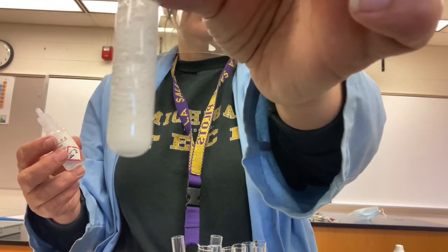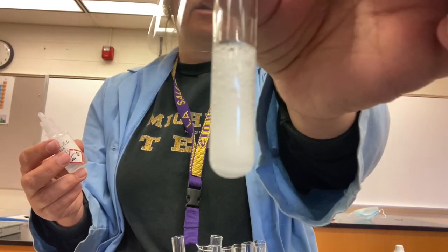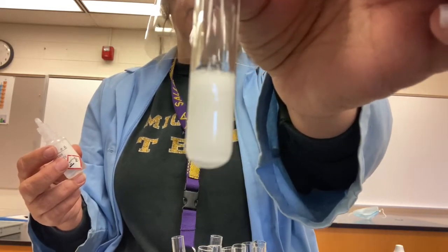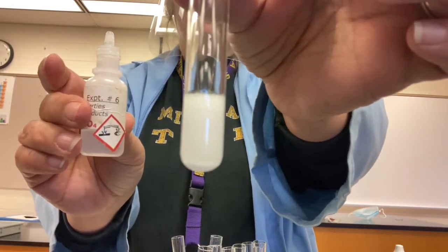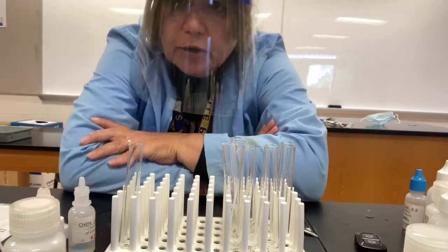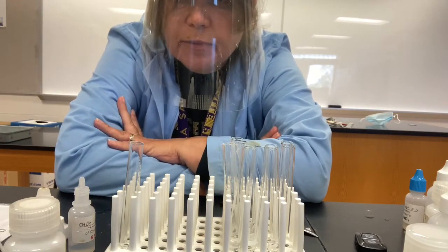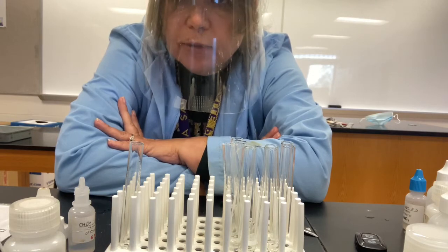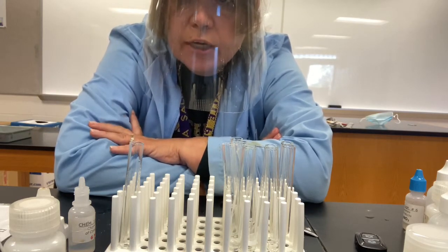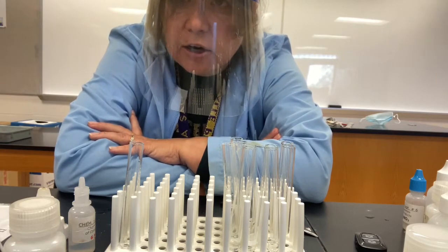So that's an indication, the bubbles are an indication that we have carbonate ion or bicarbonate ion, either one. In this case, it's bicarbonate ion, and it produces a lot of bubbles when reacted with an acid. So we saw the reaction of sodium bicarbonate with an acid produces bubbles. So that's caused by the bicarbonate ion, so that's a test for bicarbonate or carbonate ions to see if they're present or not. Now we're going to confirm what we suspect the bubbles are composed of, and that's carbon dioxide.